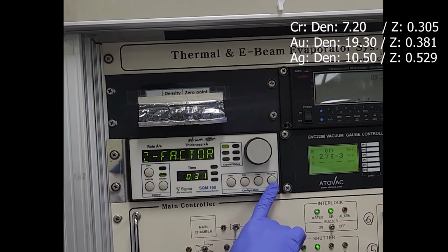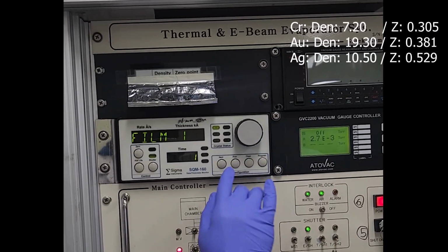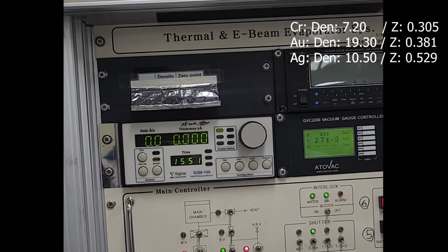If you click program and didn't click next, you didn't check, and you click program again, there is no setup.